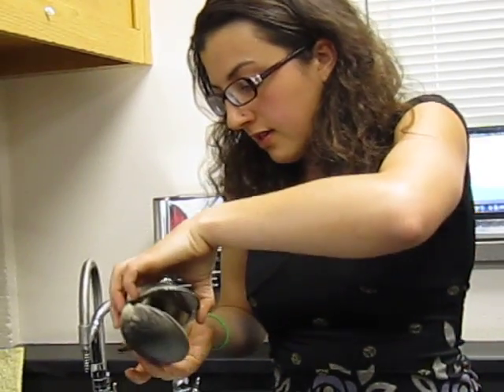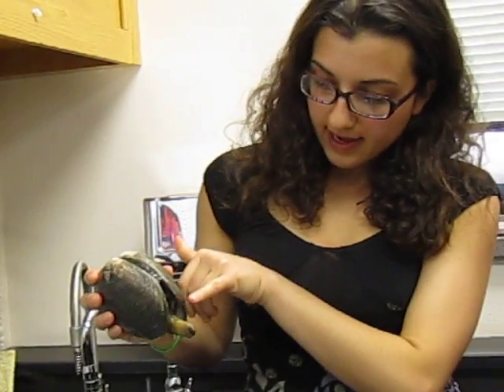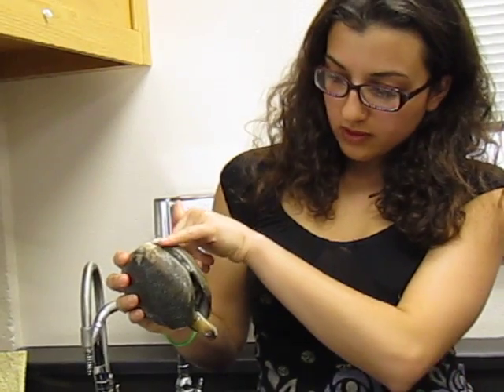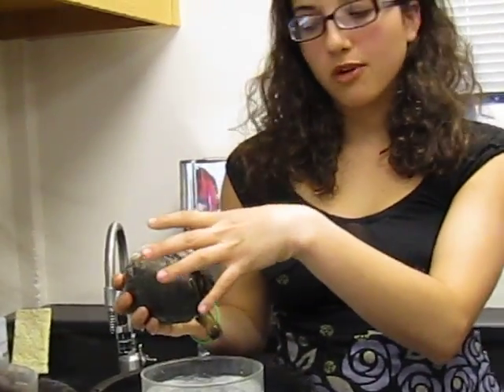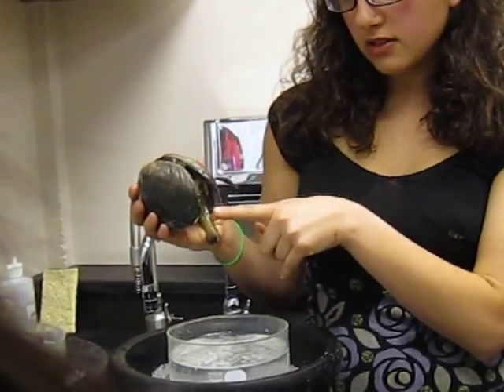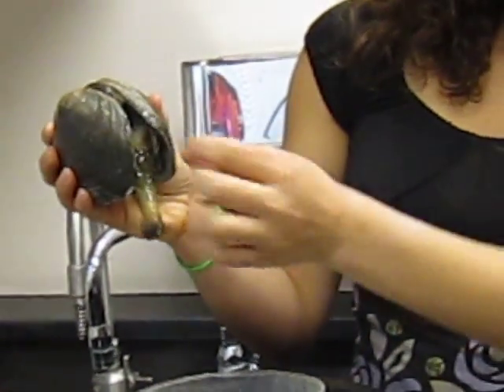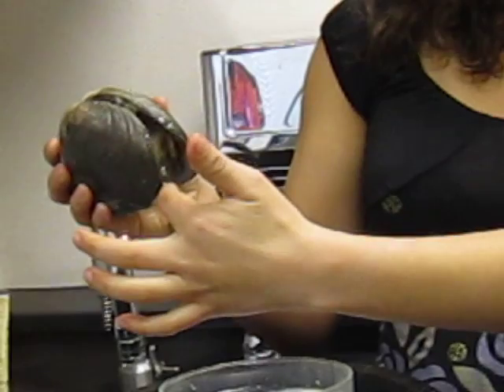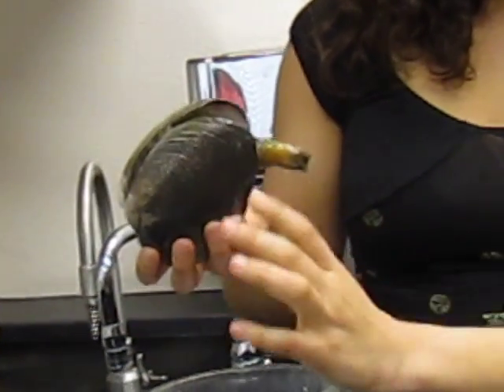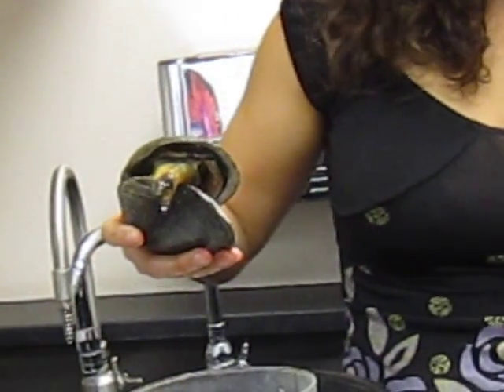It becomes easier once you start looking at it more, but the excurrent siphon is going to be dorsal. The incurrent siphon is going to be ventral, and once you start to get a sense of where other portions of clam morphology are, it makes sense that this would be the excurrent, because the digestive system ends here, the anus is here, and so in the visceral mass up here, you're going to have waste expelled through the top, which is the excurrent siphon. So we start by going through the flow of water through the clam.